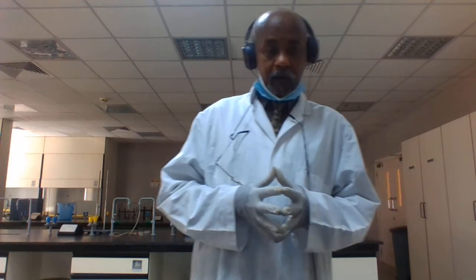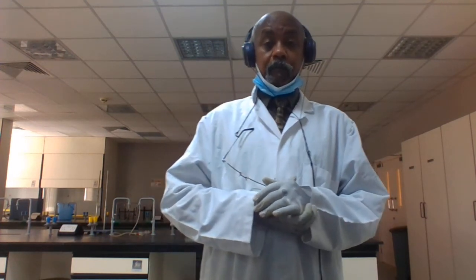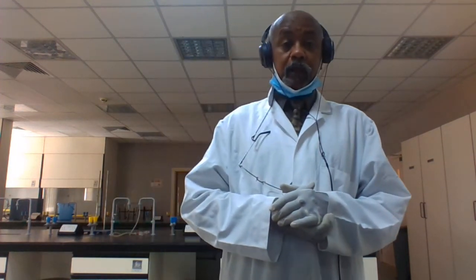To test this, we have to bring some samples and identify what the sample contains, whether it contains protein, carbohydrate or lipids. This is qualitative analysis, organic qualitative analysis.